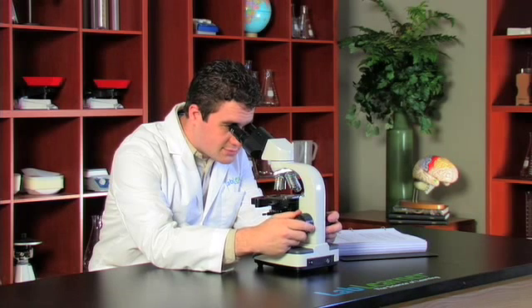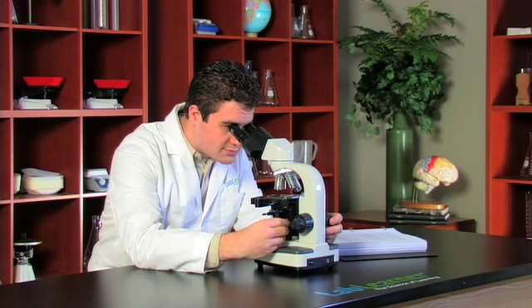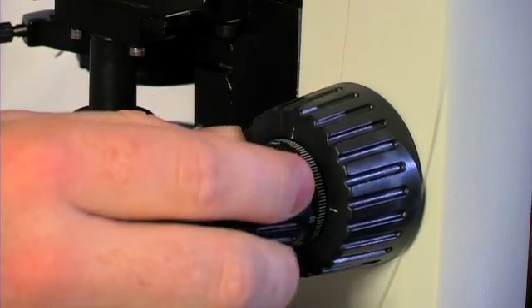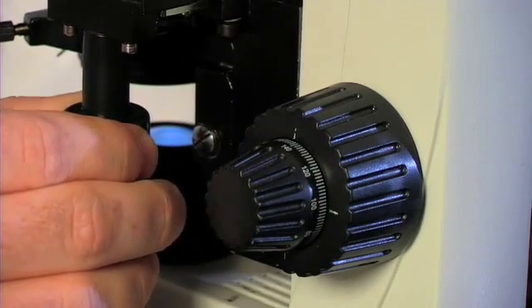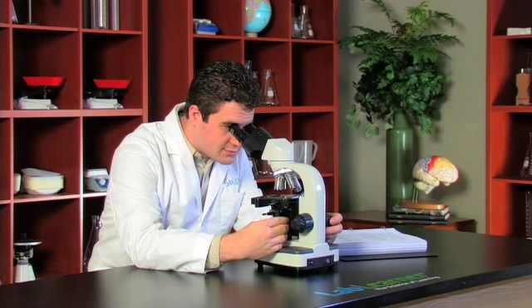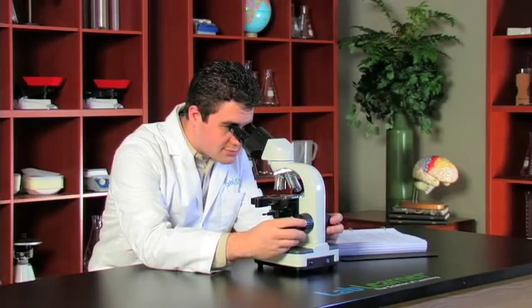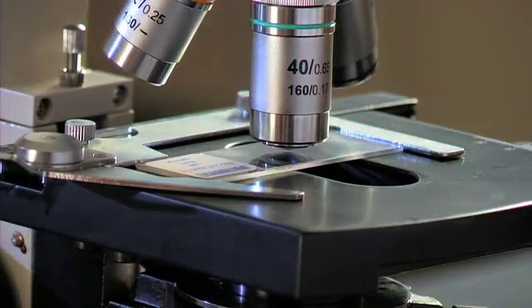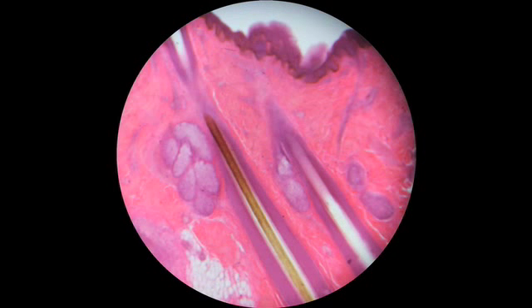We began by placing the slide on the stage in its lowest position and then raised it up until it comes into focus with the lowest objective. We can then find focus and translocate using the translocation knobs. Once we're focused at the lowest objective, we can begin to increase the power. From this point, we should only need to adjust the fine focus.